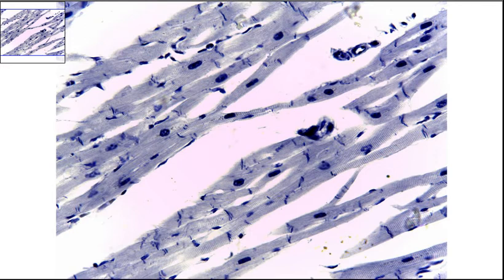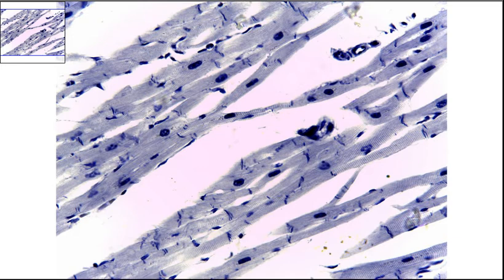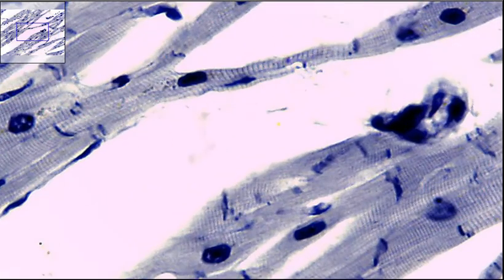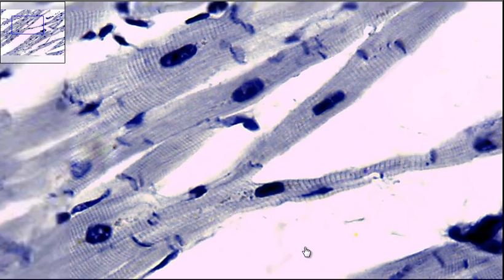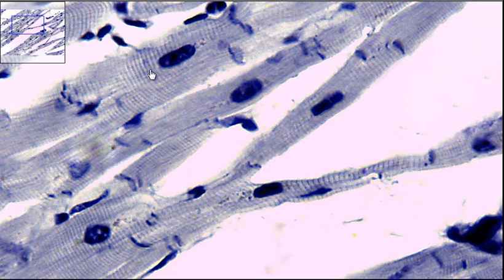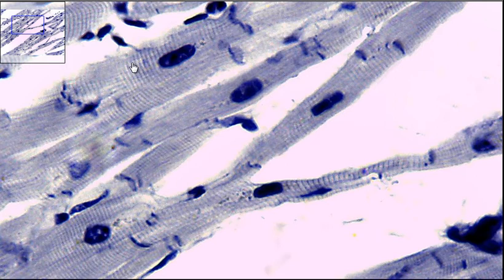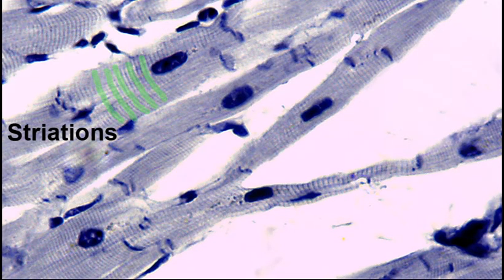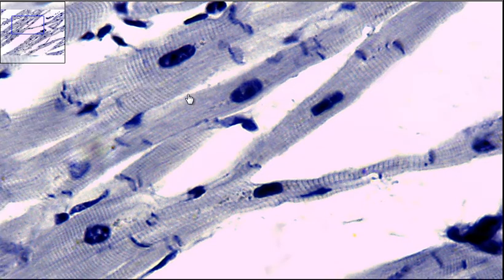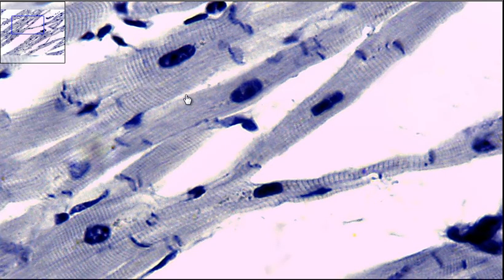What we're looking for are going to be the distinguishing features that make up cardiac muscle. We're going to be able to notice that we have striations in the cells. The striations, or these lines going back and forth, are similarities to your skeletal muscle.